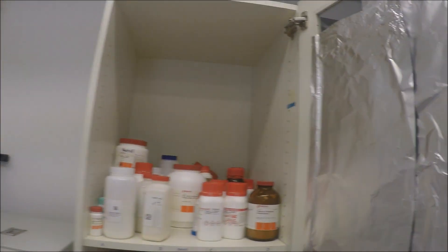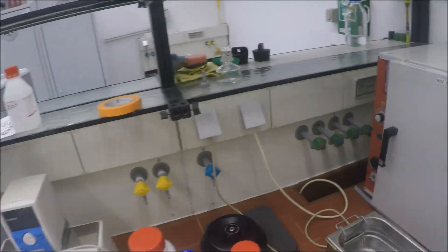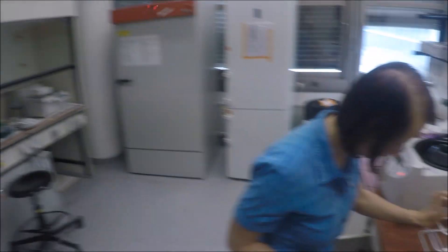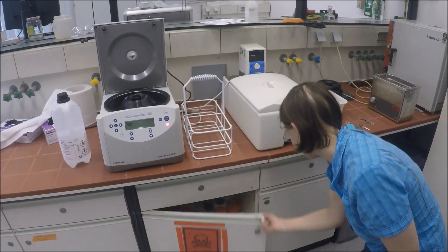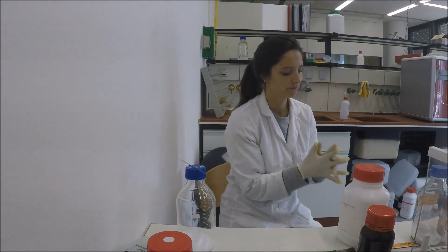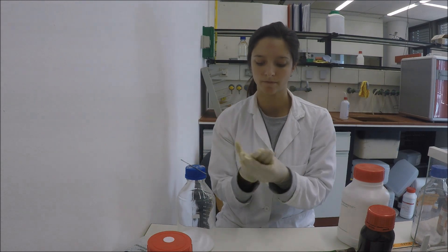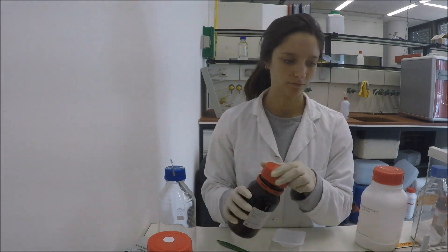So I prepare artificial seawater, which is a combination of chemicals, nutrients, or salts. Seawater has a lot of salts — of course the most predominant one is sodium chloride, but it has many others. That's why I have to take so many out of the cupboard to prepare my artificial seawater. There's one which is actually toxic in high concentrations and Barbara, our lab manager, has to give me access to it.